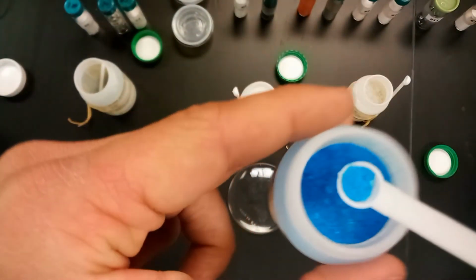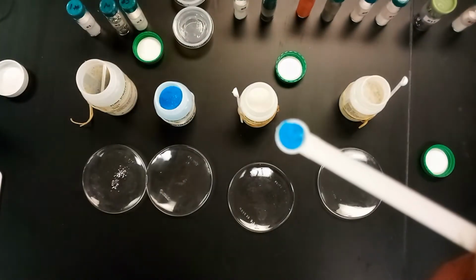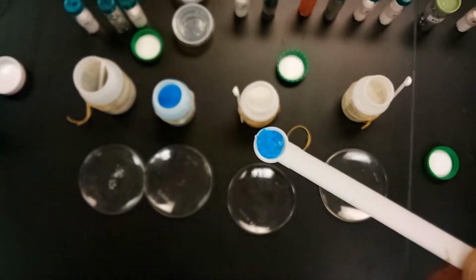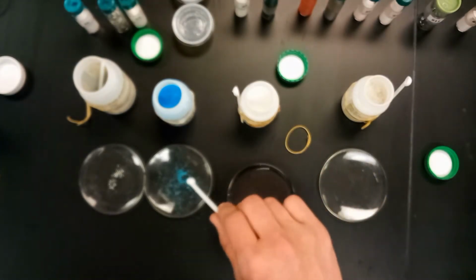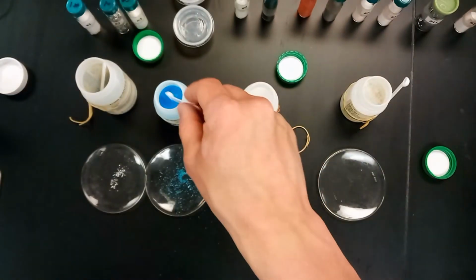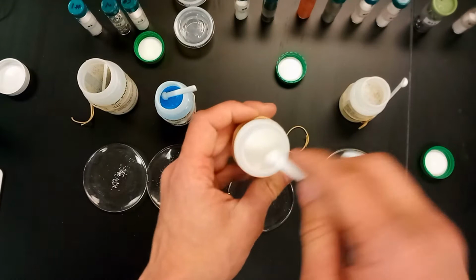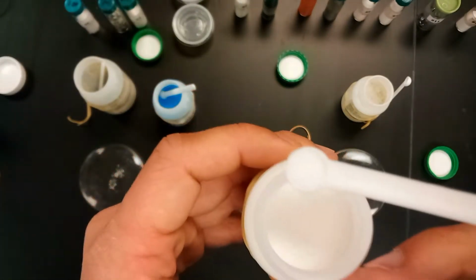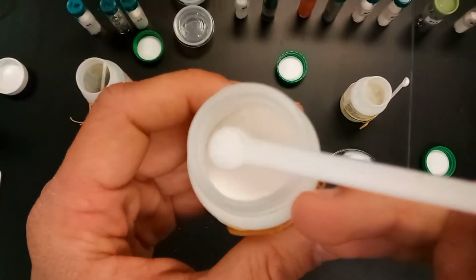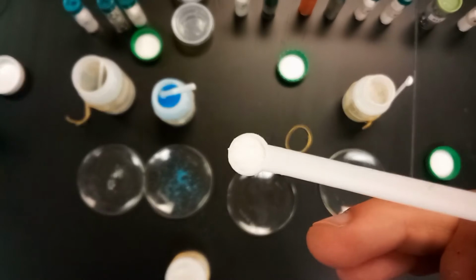We always think of this as having crystalline structures, right? So that's what we can see here. The copper, of course, making it relatively blue. Here we have dextrose, which is sort of a sugar. If you know what sugar looks like, this is kind of just a fine sugar, I suppose you could say, because yeah, it is very, very fine.